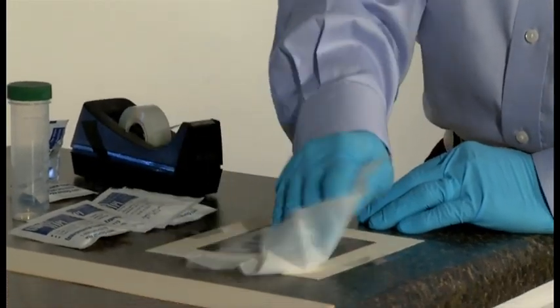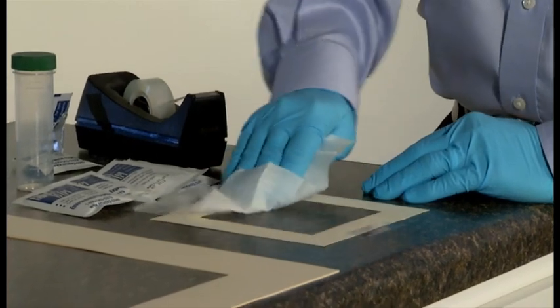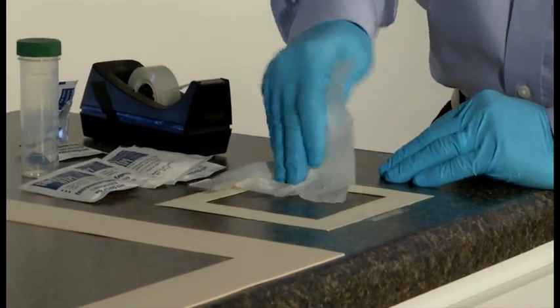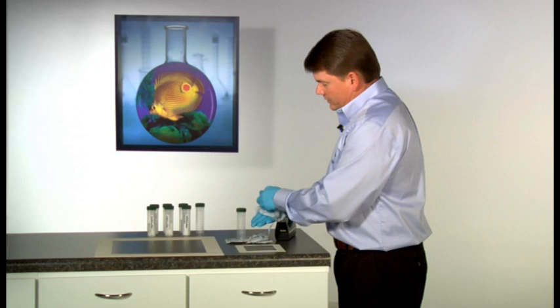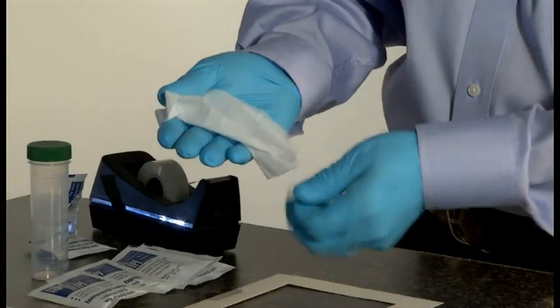In an S-pattern, wipe the surface from left to right. Fold the wipe, making sure the dust is on the inside fold.